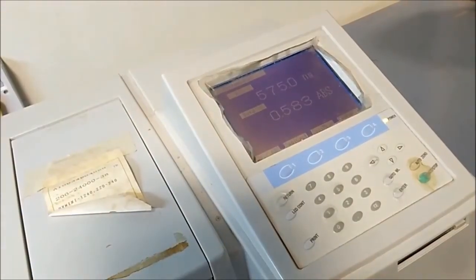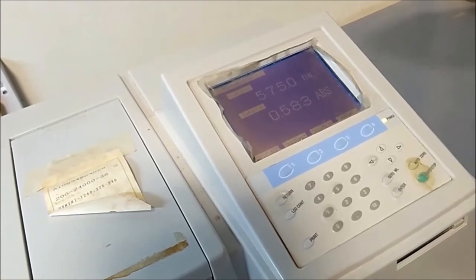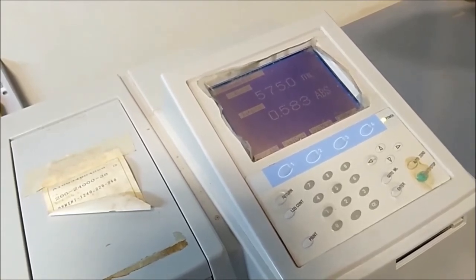After that, press auto zero to change the absorbance value to 0.